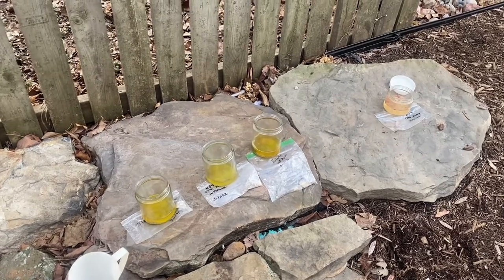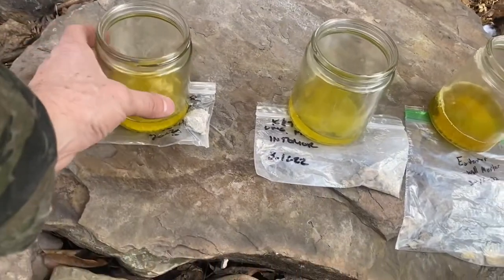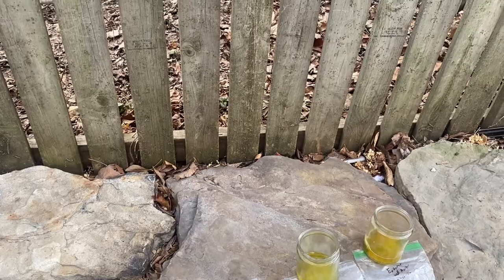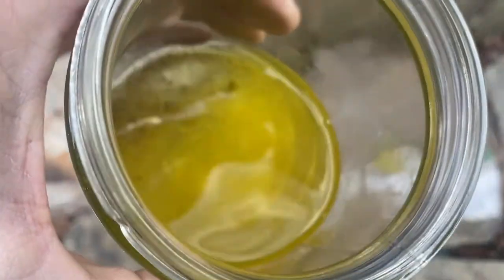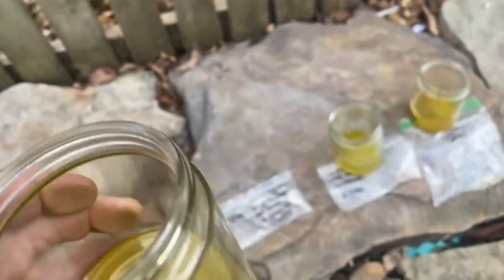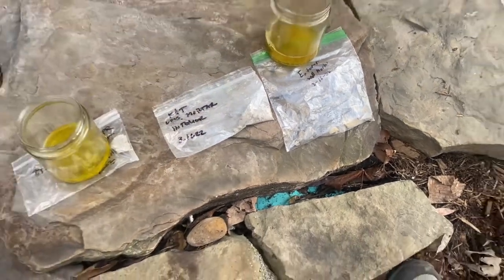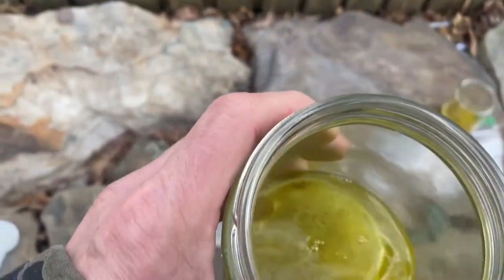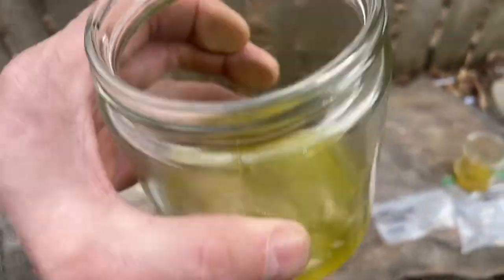It's been about 20 minutes, let's see how we did. This is the exterior stucco sample from Burnham, and it has been entirely consumed — so that's a lime base. The Kearney and Trekker original mortar from the interior is also completely consumed, so that must be lime based.